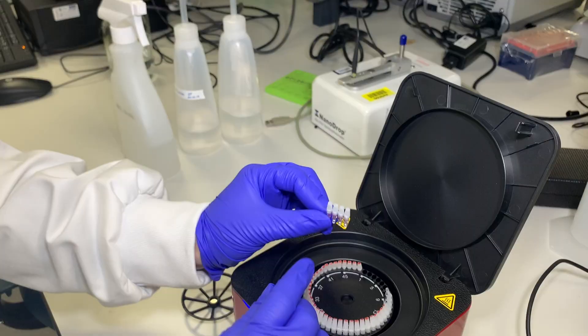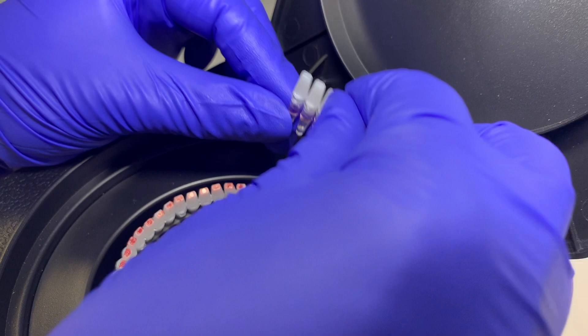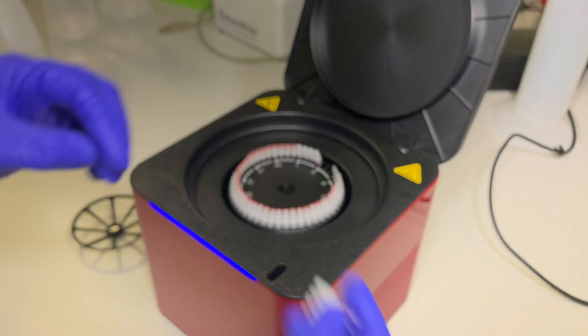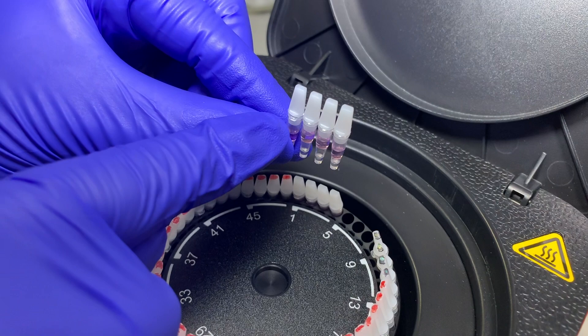Remove enough balance tubes to fit in your samples. Line up the notch on the first tube with the image and place the tubes into the machine. Repeat for the remaining tubes.